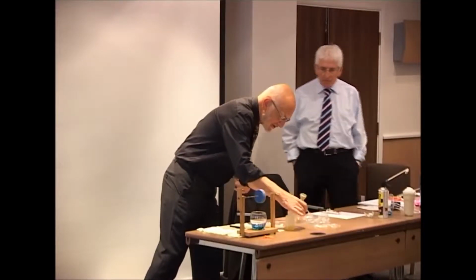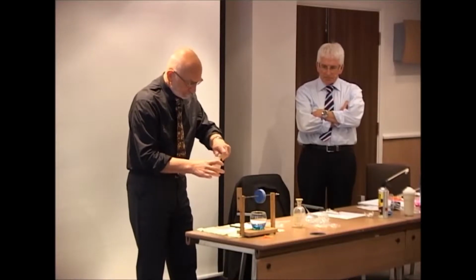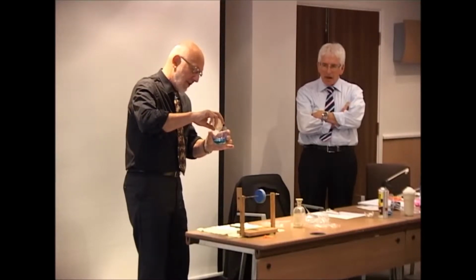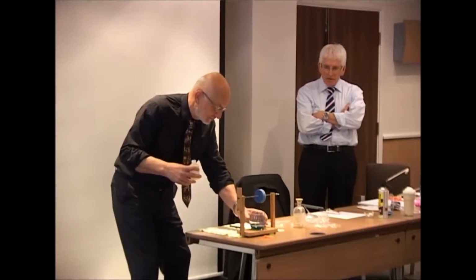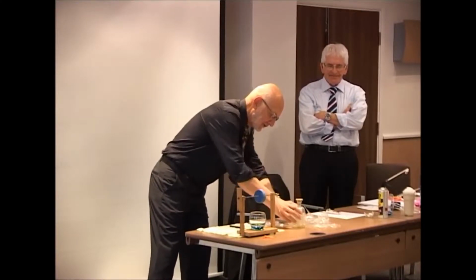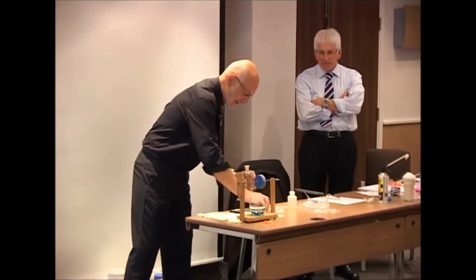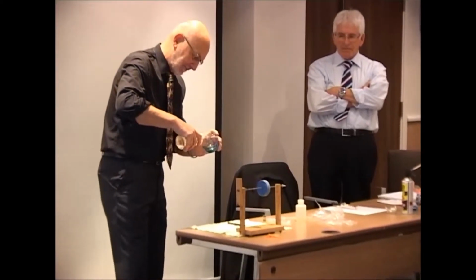And what I want to do first is to put in some diamine to this lovely beaker. Diamine is dissolved in water, by the way. This is hexamethylene diamine dissolved in water. That's gone in there. And the diacid chloride, for two reasons, is dissolved not in water, because it won't, but it's dissolved in hexane, which is organic, it doesn't mix with water. It's also less dense than water, so it should float on the top.